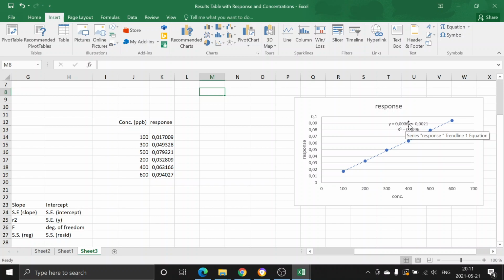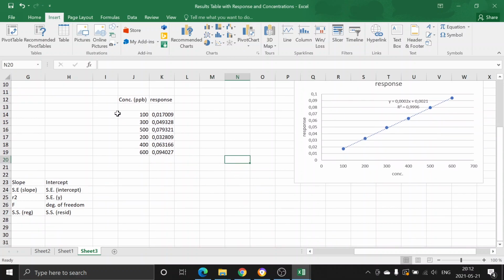You have to use the LINEST function in Microsoft Excel to calculate the slope value with a satisfactory amount of significant figures. Okay, do not use the 0.0002 slope, which is given by the trend line equation. Let's insert a LINEST analysis into this data set, and let's calculate the slope with multiple significant figures.